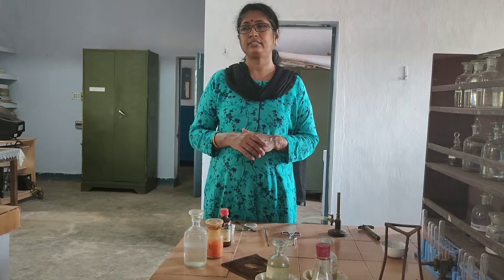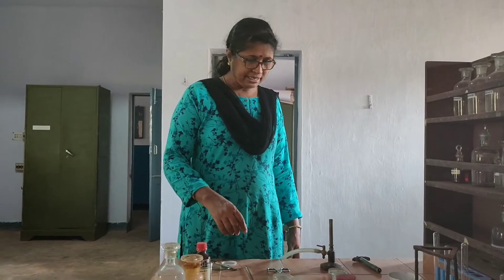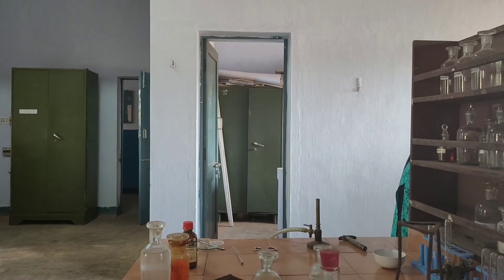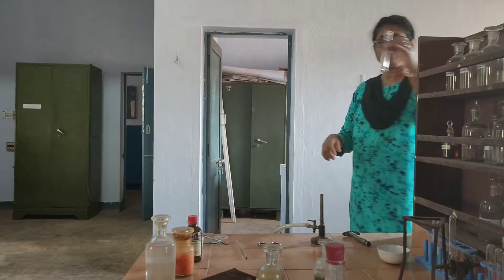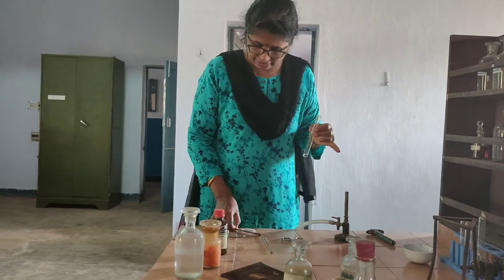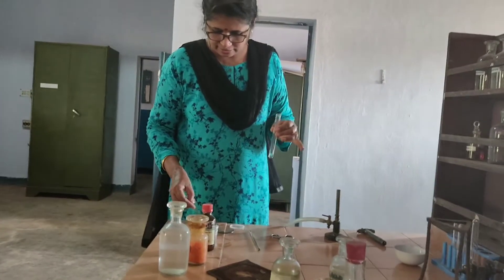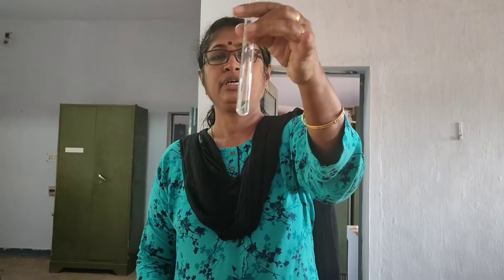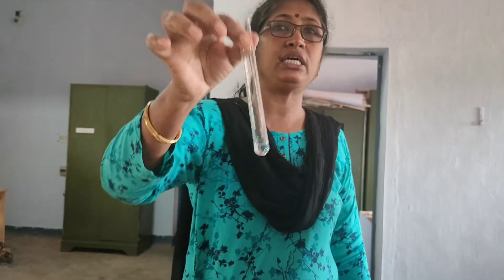The next preliminary experiment is solubility. Take a test tube, add a small quantity of water, then add a little salt and see whether it is soluble in water. This substance is soluble in water — you can see it is transparent — so all insoluble substances like carbonate, etc. are absent.